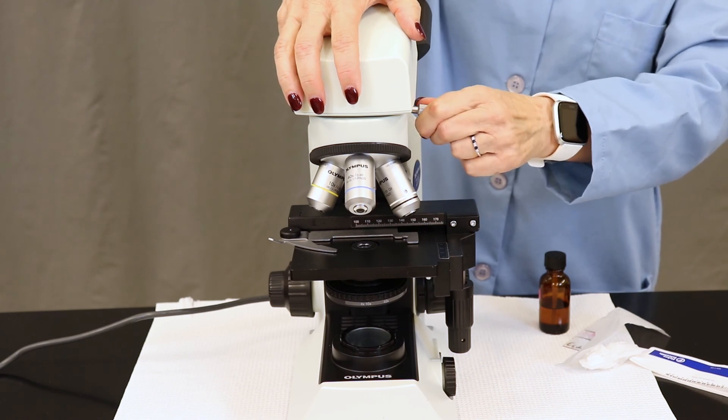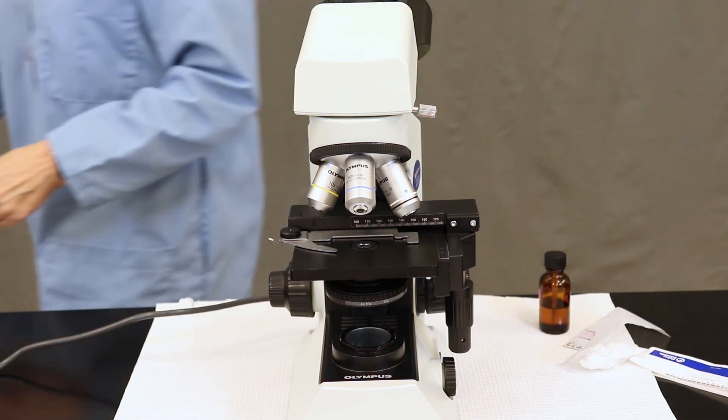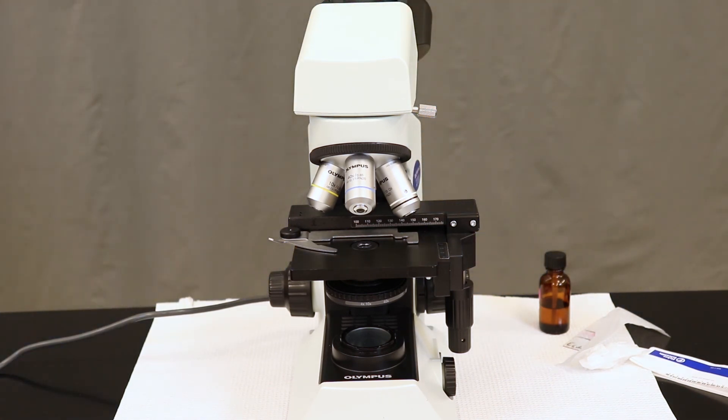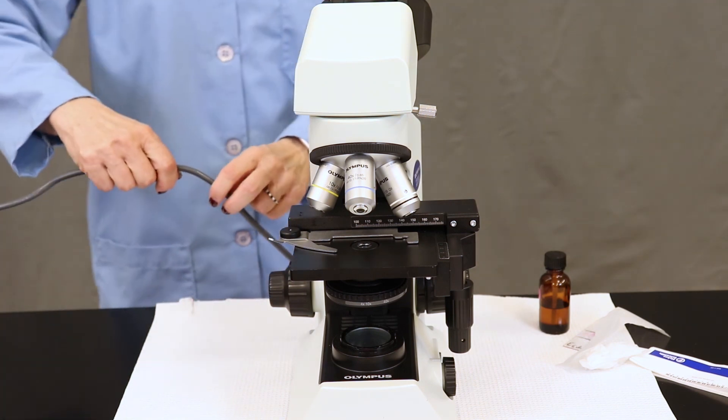Tighten it in position in place. Make sure your light source is off, unplugged, and put away in the appropriate cabinet.